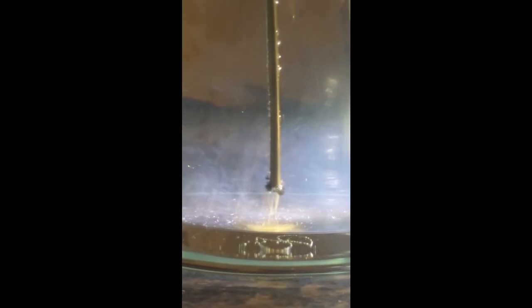You can see silver clouds have come off the positive rod on the right. That looks quite desirable. And we get this accumulation of dirt or what they call dross in America on the negative rod here. You can just see this sort of dirt coming off the rod there and the accumulation of this black stuff on the rod.